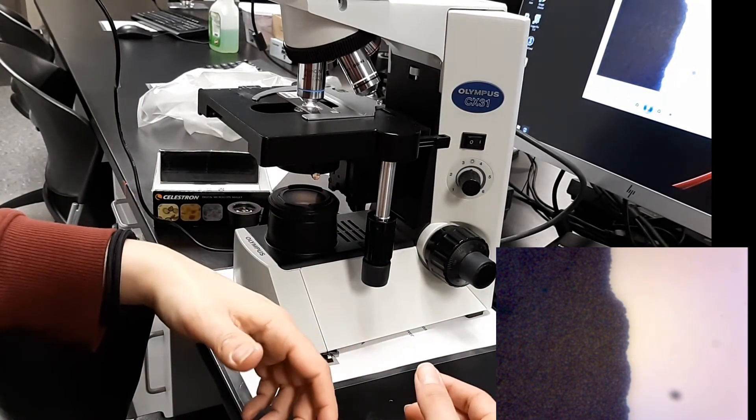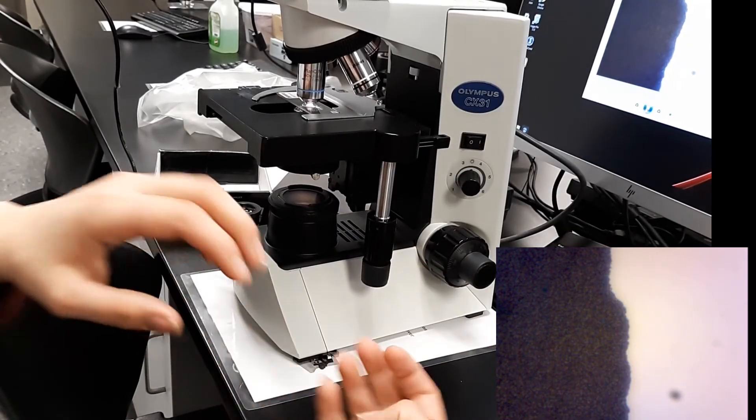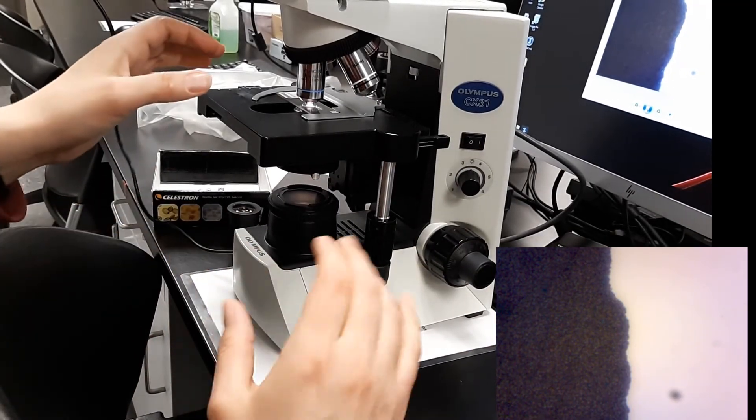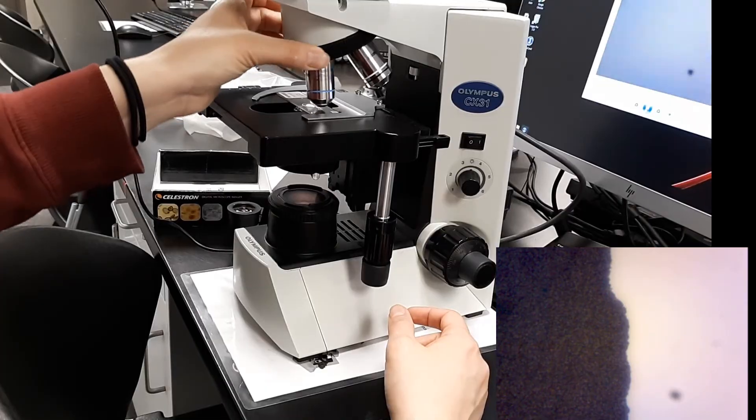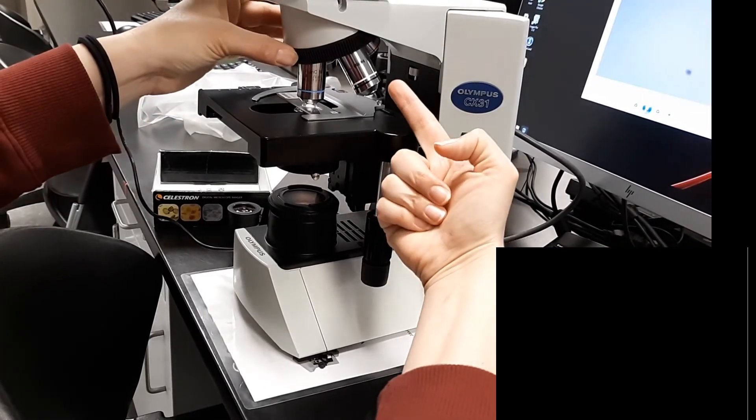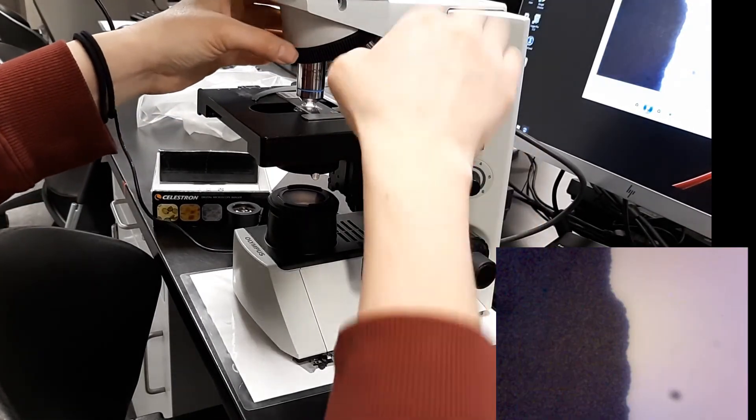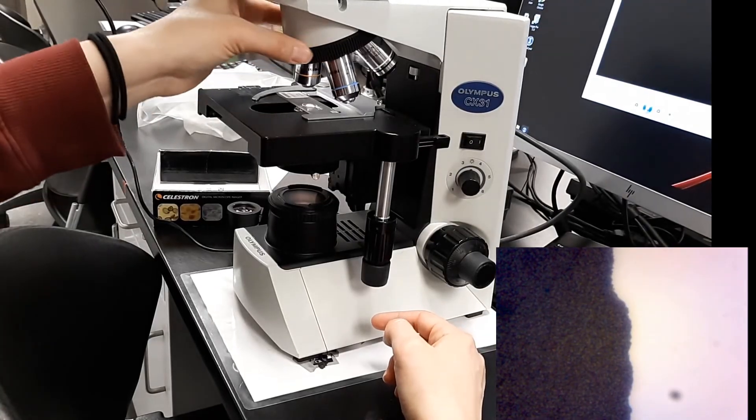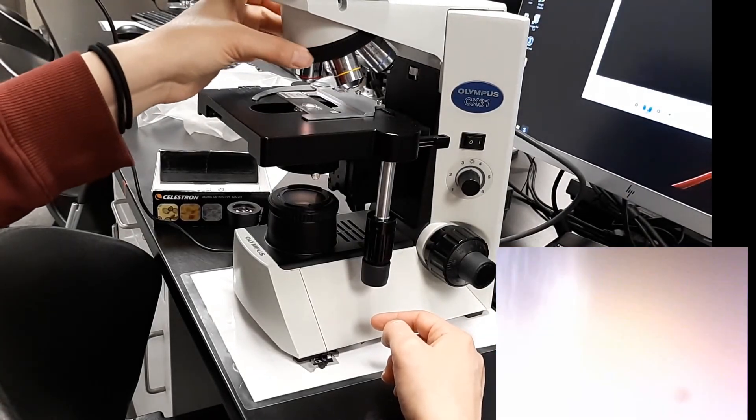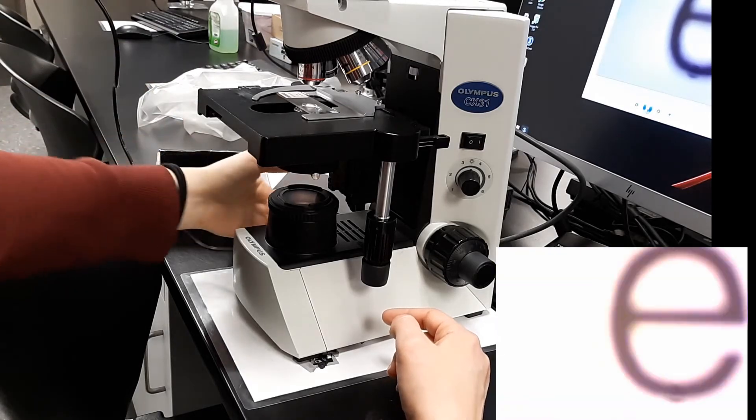Okay, so a quick review. This was the bottom to top. We used red, yellow, then blue. You always want to start that way. By the way, we never use this one right here. You don't even rotate through the field of view. You're just going to rotate back down through yellow, back down to red.